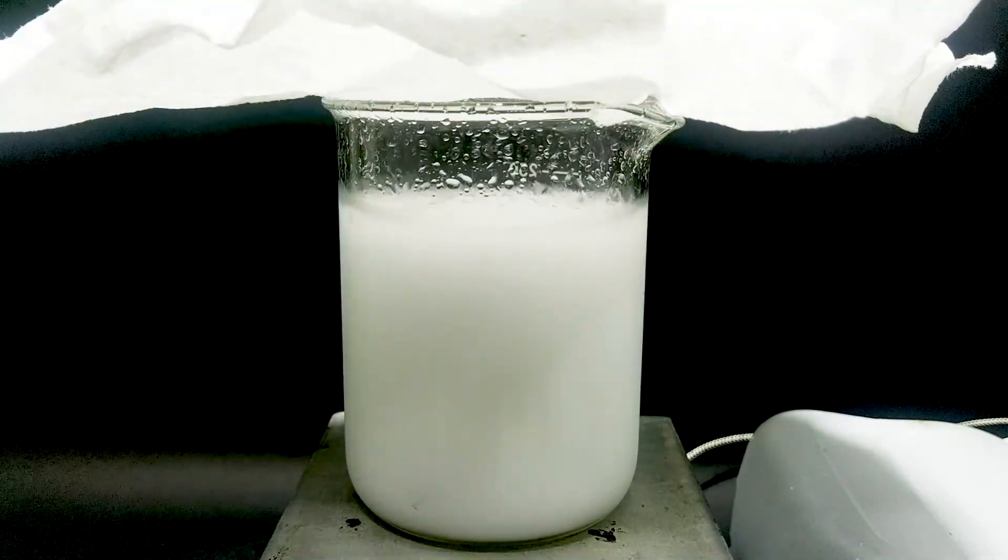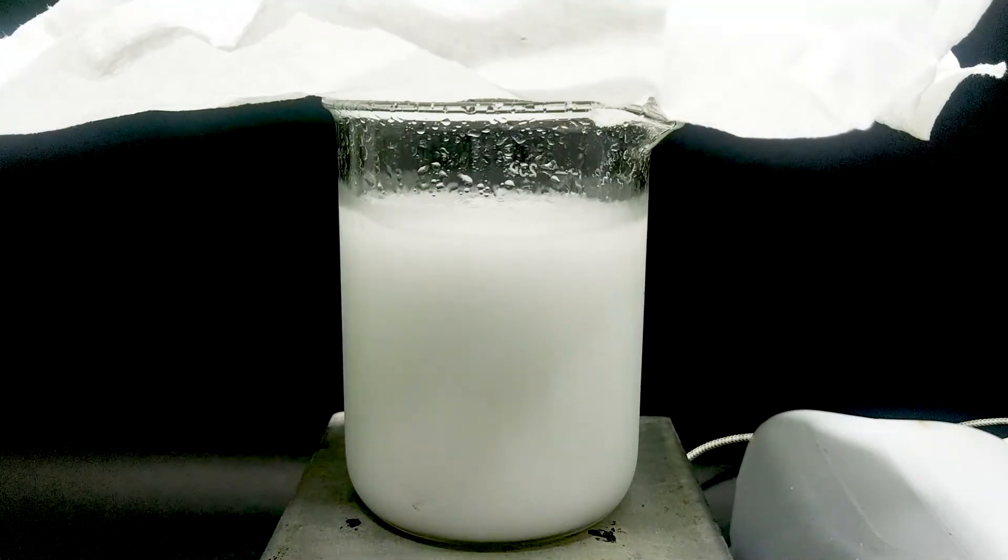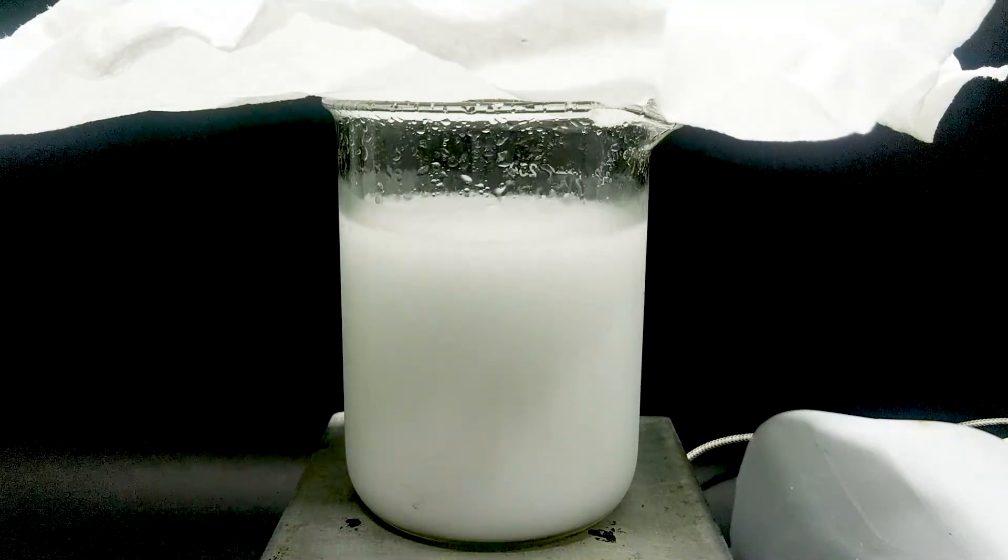In this case, citric acid is the acid and sodium carbonate is the base. By neutralization, sodium citrate will be produced, which is a salt.